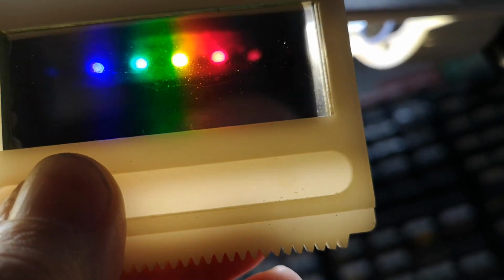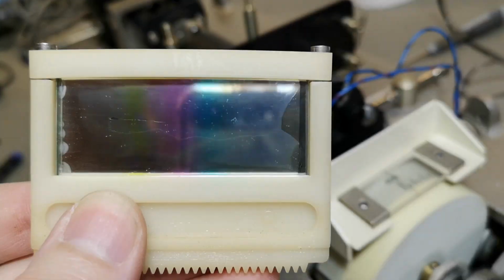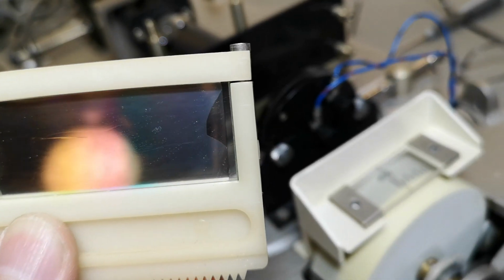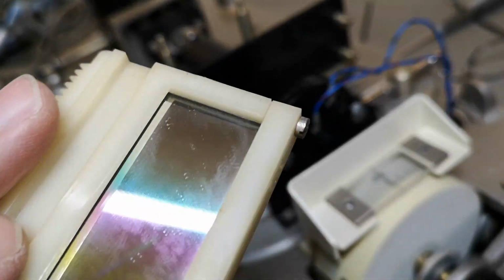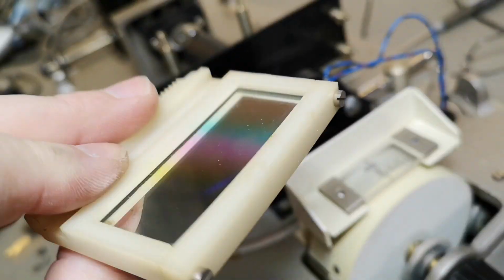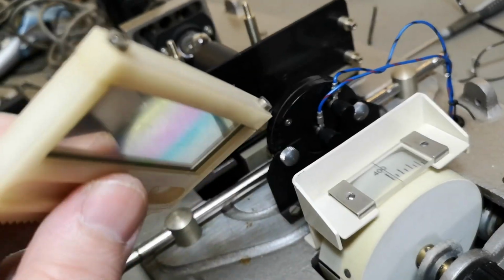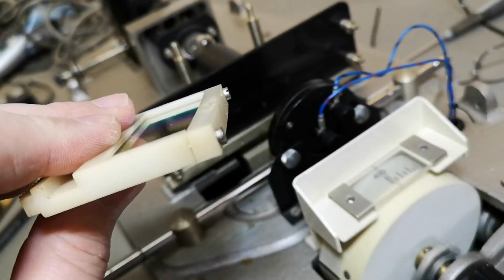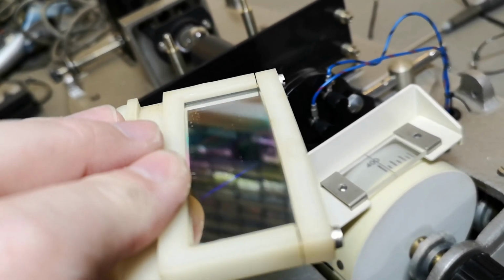Isn't this just nice? So this is the color filter. It is a little bit dirty, and some kind of chemicals went in there, I guess. Whoa, it is really, really dirty. But it still works. It's also very, very heavy. So I guess, oh yeah, it's very, very thick, this kind of glass. Maybe it consists of many layers of funny things.